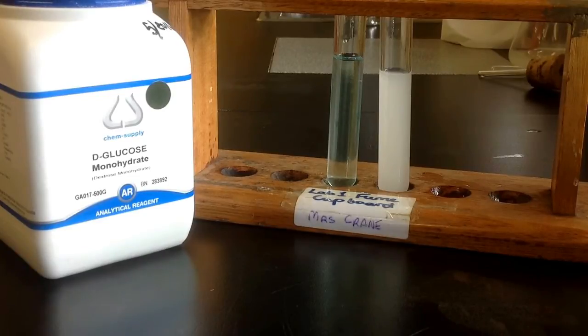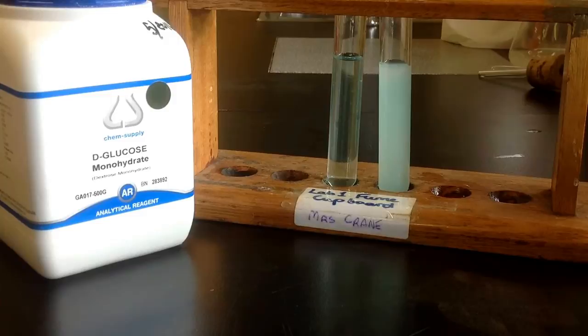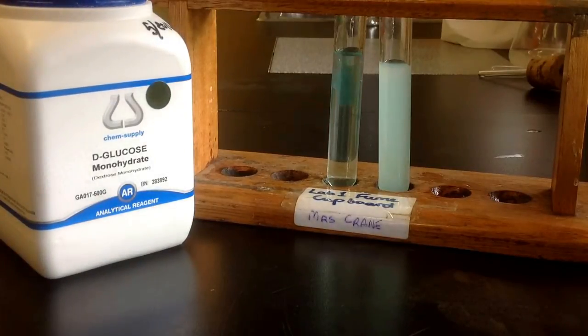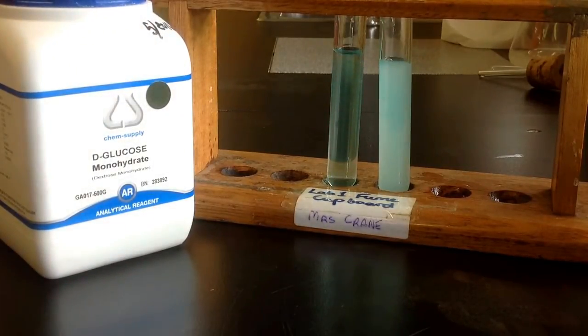So put a squirt of Benedict's in both of these, maybe two squirts to get the color nice and strong. I've got some even hotter water because that could have been a factor last time.